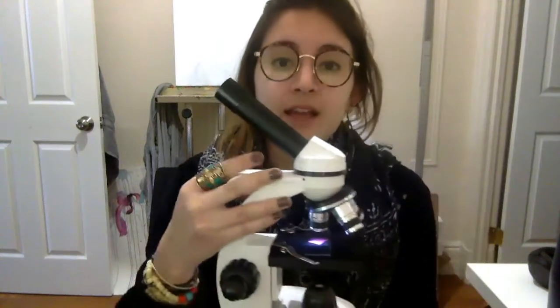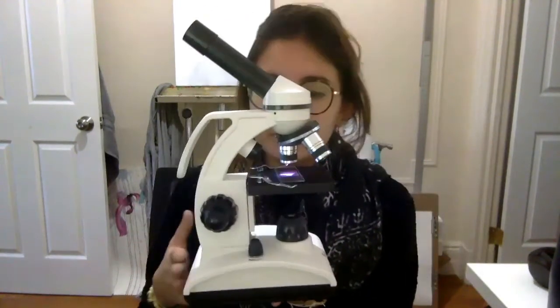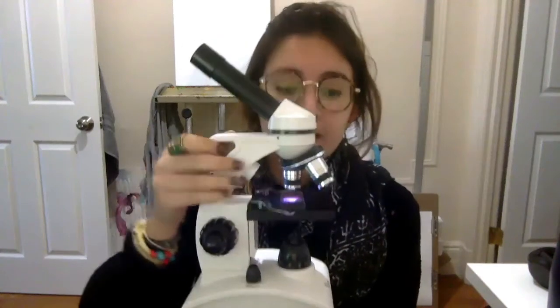When I'm not at WBs with you, I'm usually using stuff like microscopes or other things since I also study science. So today I'm going to show you what a microscope does. We're going to look at some things under the microscope.